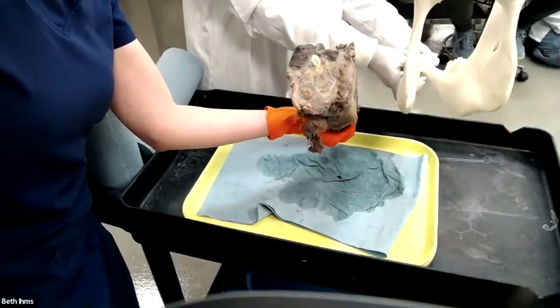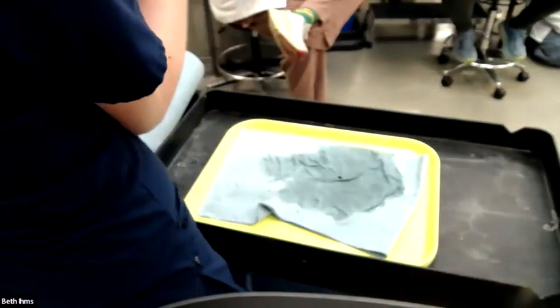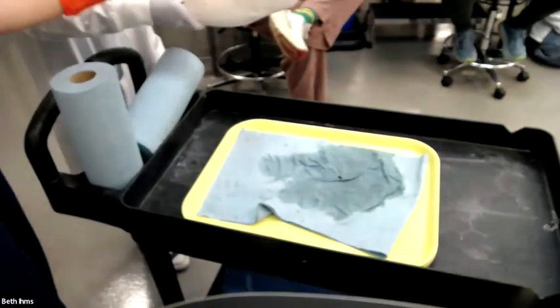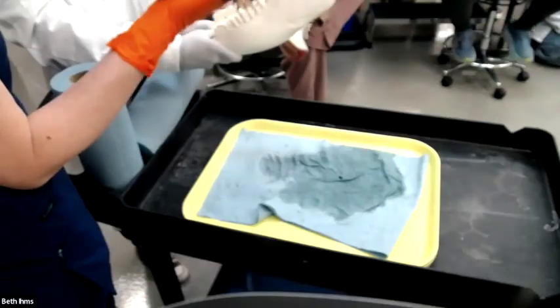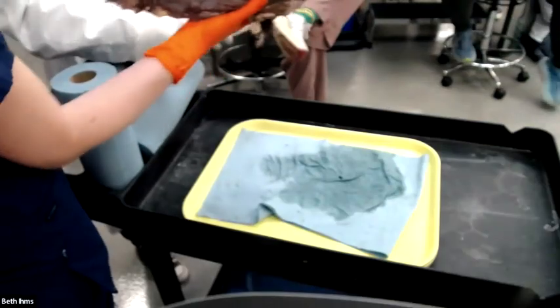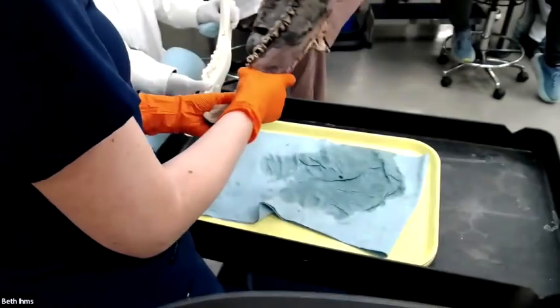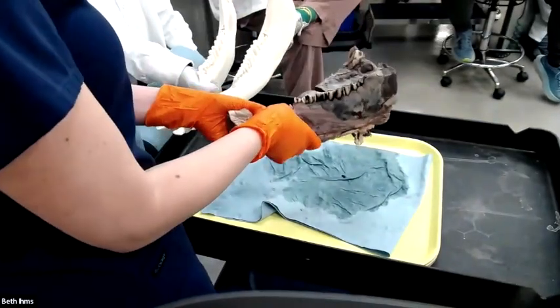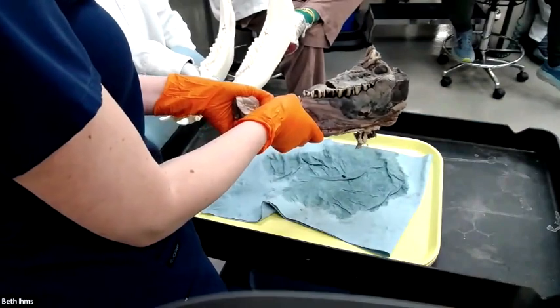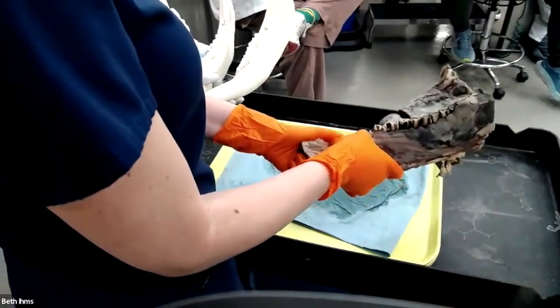One of the common things you'll hear me say over and over as an approach to lesions is, has something been added to the tissue or something lost? So what do we think when we're doing a side by side? We have added hella tissue to this thing. It's even super heavy compared to that. So describe it. What kind of descriptors would you use if we're doing spot the difference and this is that? What would you say about this? What are some words people use? That's a noun. It's an interpretation.